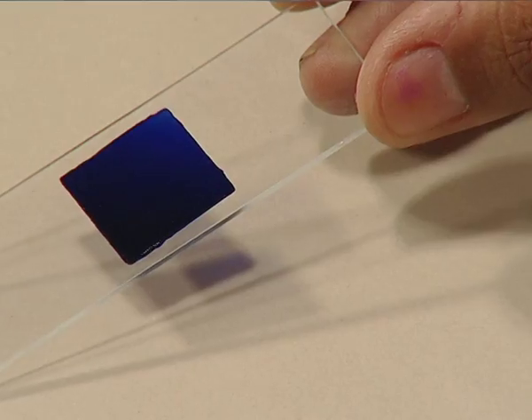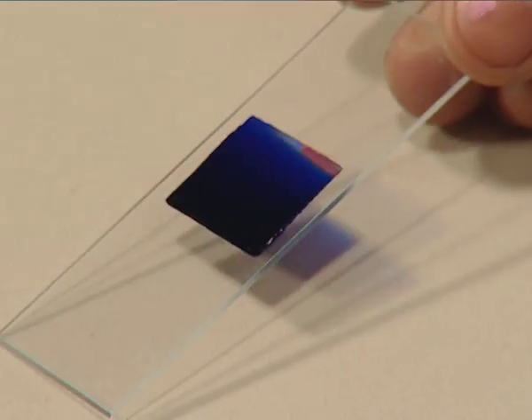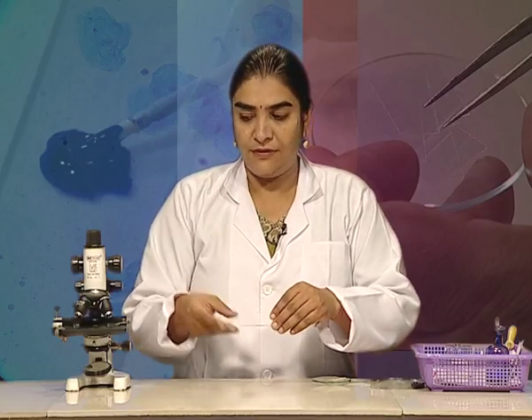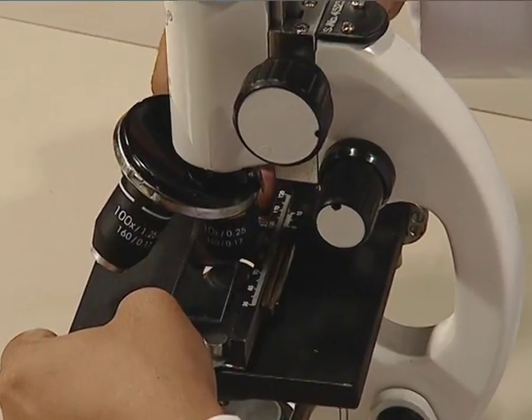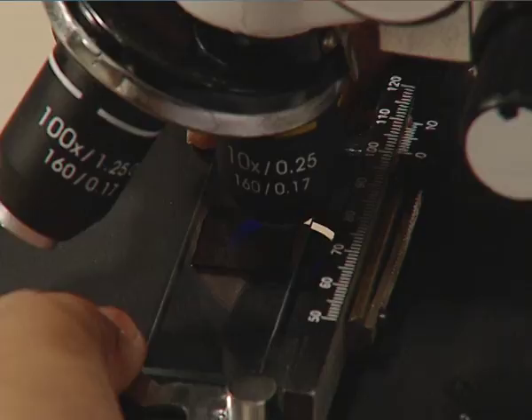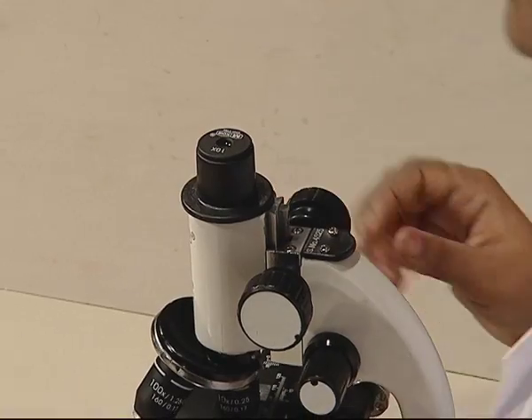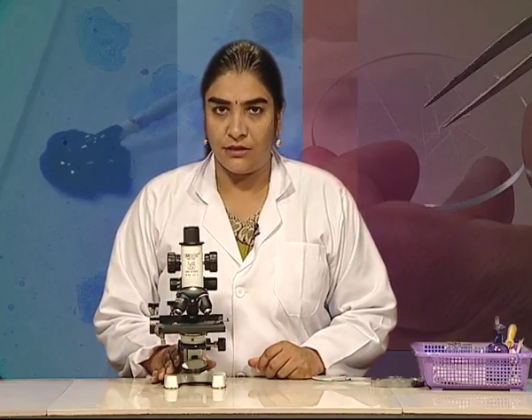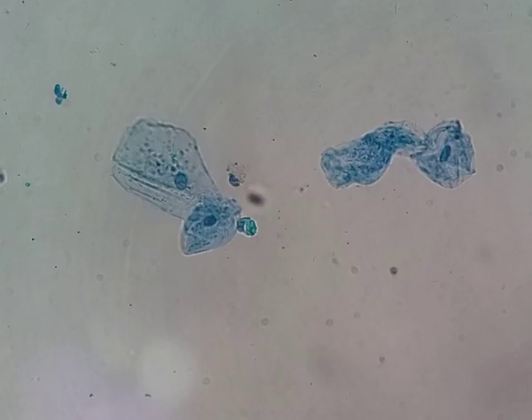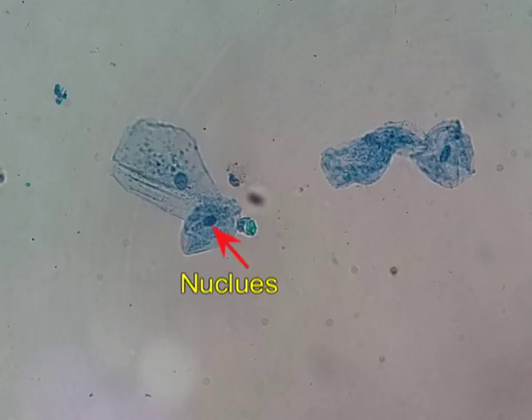The slide for cheek epithelium cells is ready. Now we will be observing it under the compound microscope. For observing the slide, take the microscope and place the slide on the stage. Fix the slide and observe it under low power. We observe the cheek epithelium cells which are irregular in shape and are stained blue in color. These cells are widespread and also show a centrally located nucleus.